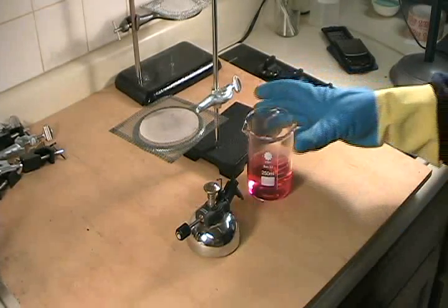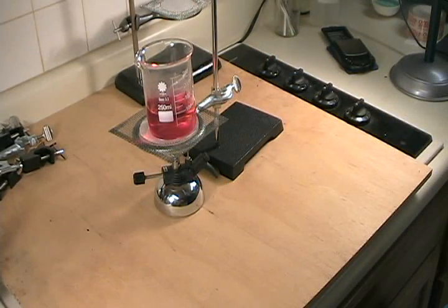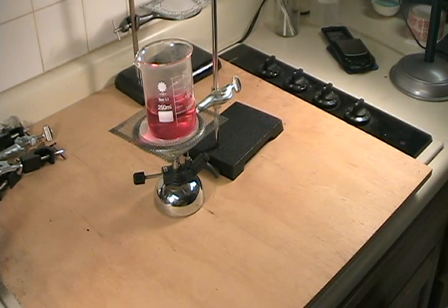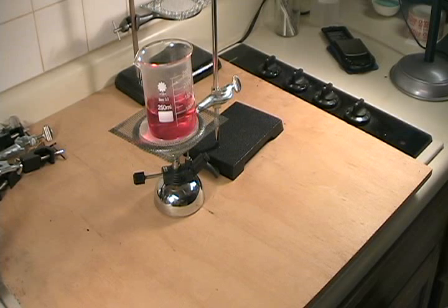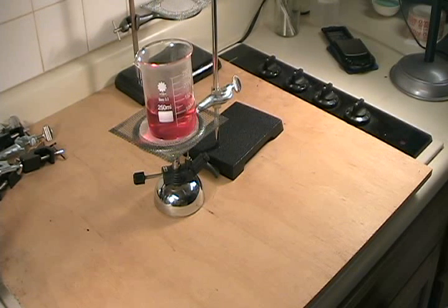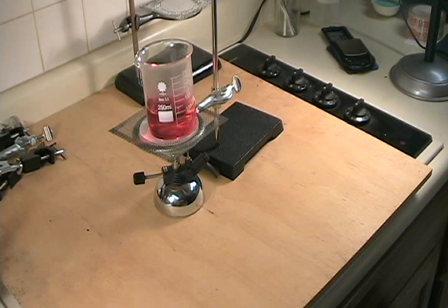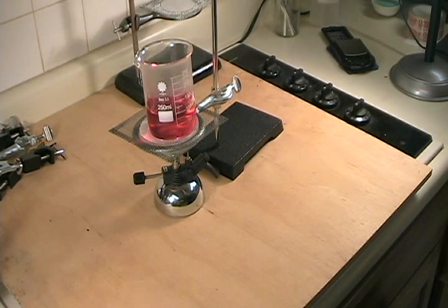The next step is to boil off all of the water present in the beaker, leaving only the solids. We'll allow the solution to come to a boil and for most of the water to boil off, and then I'm going to finish drying it in an oven. The main solid product present in the beaker is going to be sodium sulfate, initially in the decahydrate form, which has a very low melting point right around body temperature. As the water boils off you'll see a molten mass appear — that's the sodium sulfate decahydrate — which will continue to outgas water vapor until you end up with dry anhydrous sodium sulfate. We'll then weigh the beaker and determine the amount of sodium sulfate plus contaminants as dissolved solids that were in the original sample.